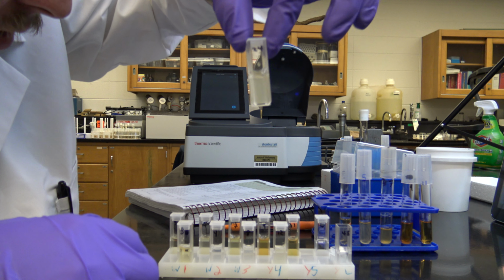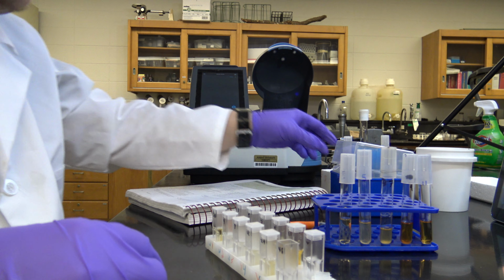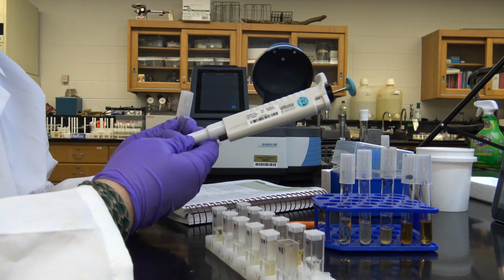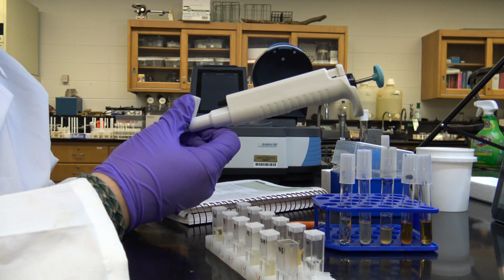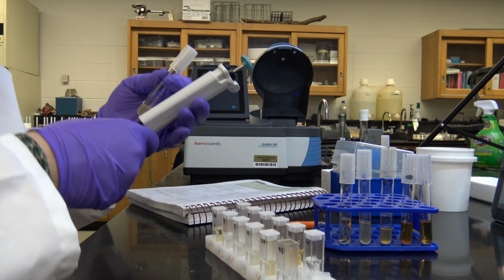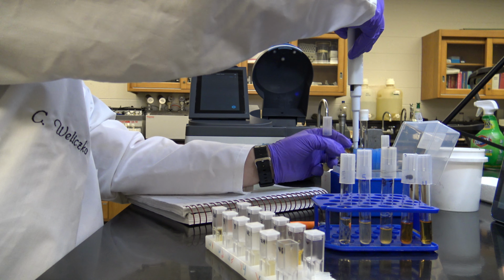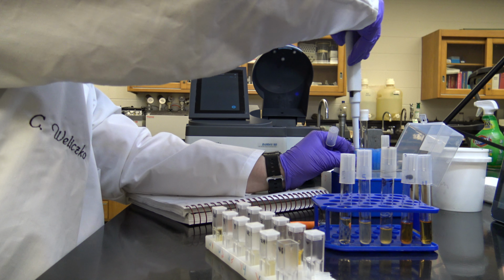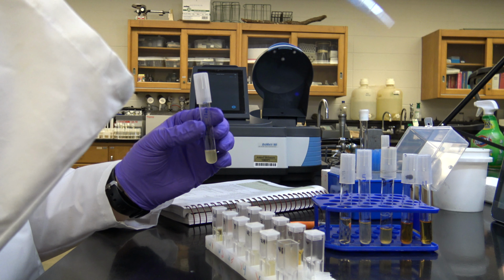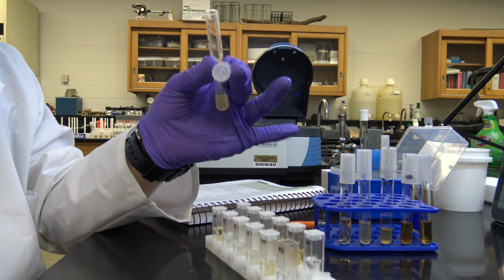and then 24 hours. And then I'm going to show you how I filled these with the 48 hours, so that you have an idea of how I'm going about this. I'm going to grab my micropipetter. This is actually a larger one, so I'm going to pipette out a mil, which is 1,000 microliters on this. Those metrics, right? I'm going to get a tip, which most of you have probably already done in lab. This tip box kind of stinks, but that's fine. So I got my tip. I'm already set at 1,000. I'm going to open up my 48-hour tube.